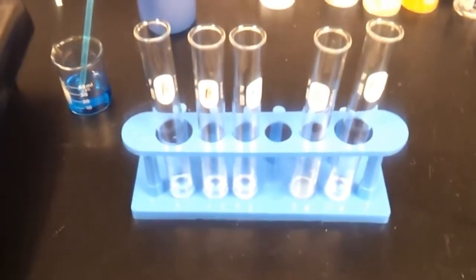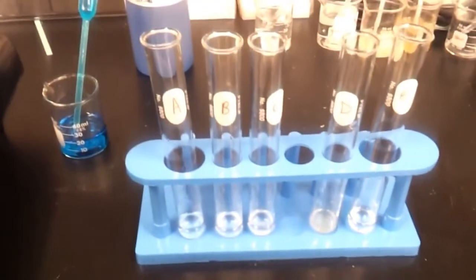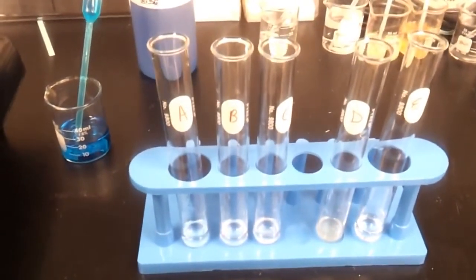Alright, so now we've reached the part of my demo where I need to video record. So here you can see I have my test tubes A, B, C, D, and E.